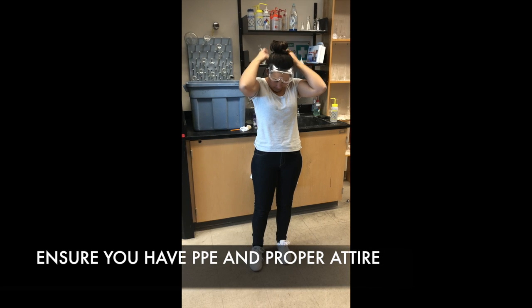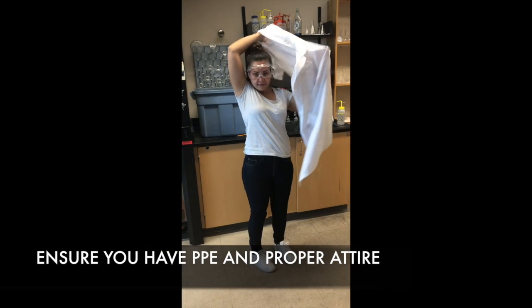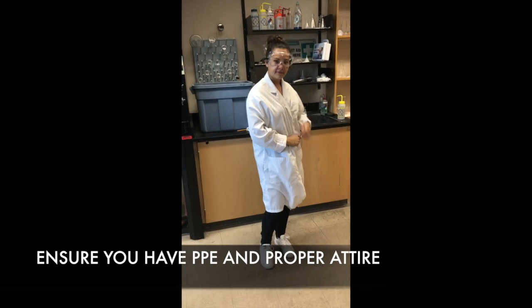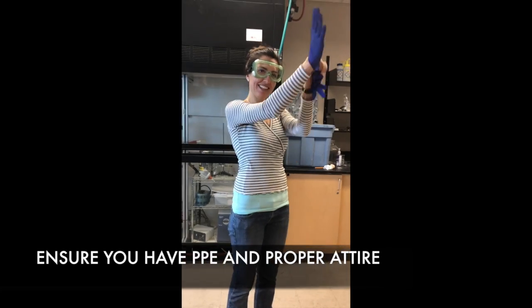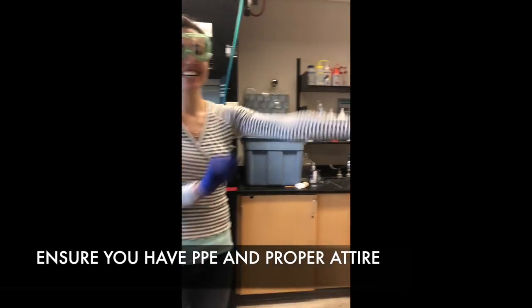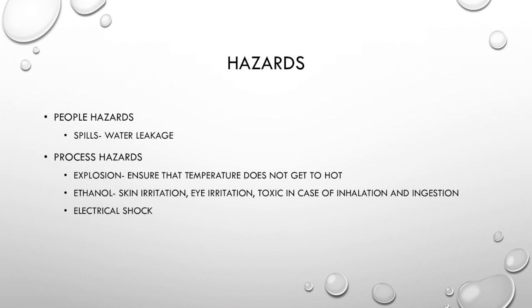You must wear your goggles at all times, as well as your lab coat to prevent chemicals from getting in your eyes or on your skin, as most of them are irritant. Gloves must be put on before handling any chemicals whatsoever. Handle chemicals like you would your phone. Don't drop them, as we don't want any spills to endanger you or your colleagues.